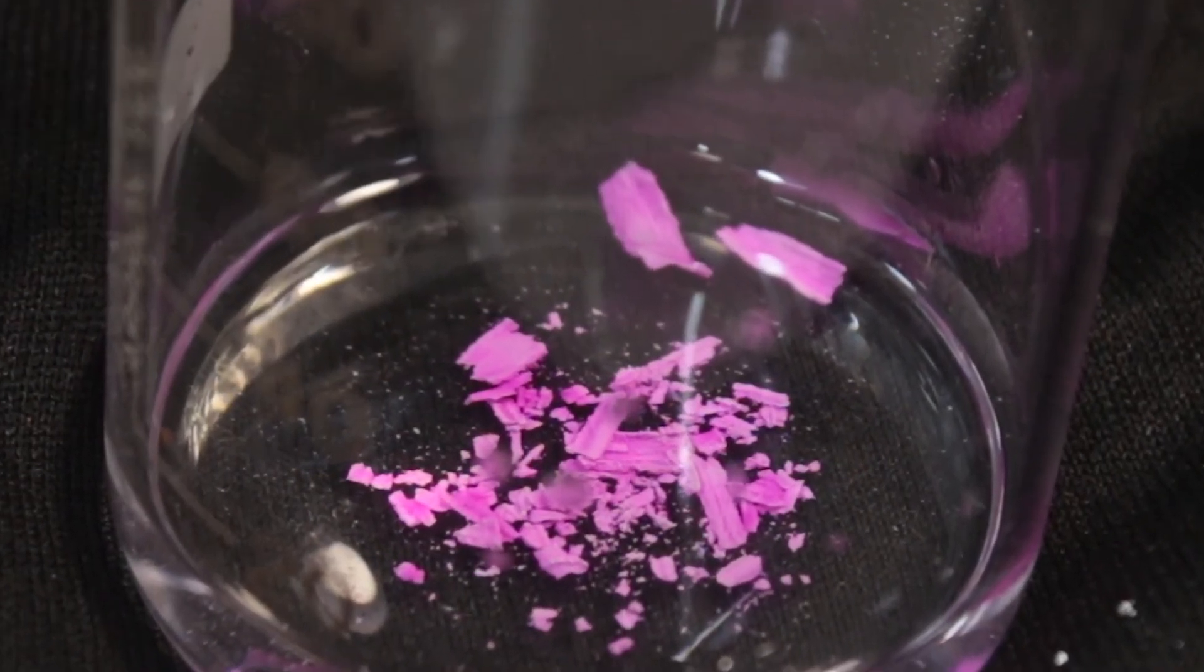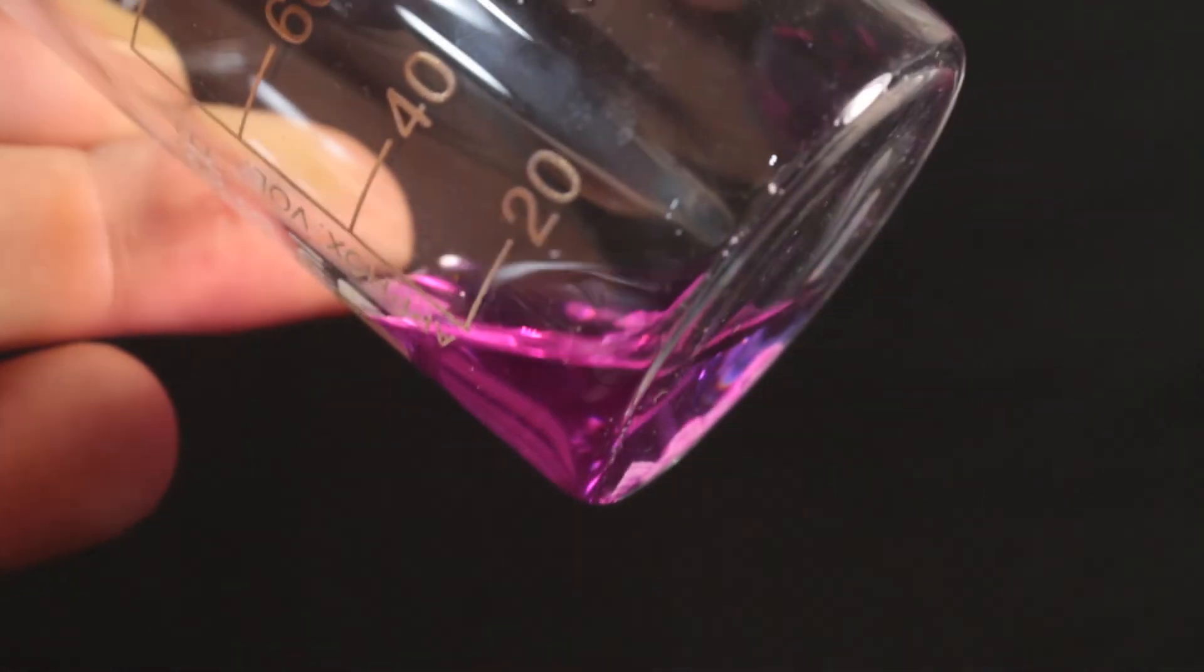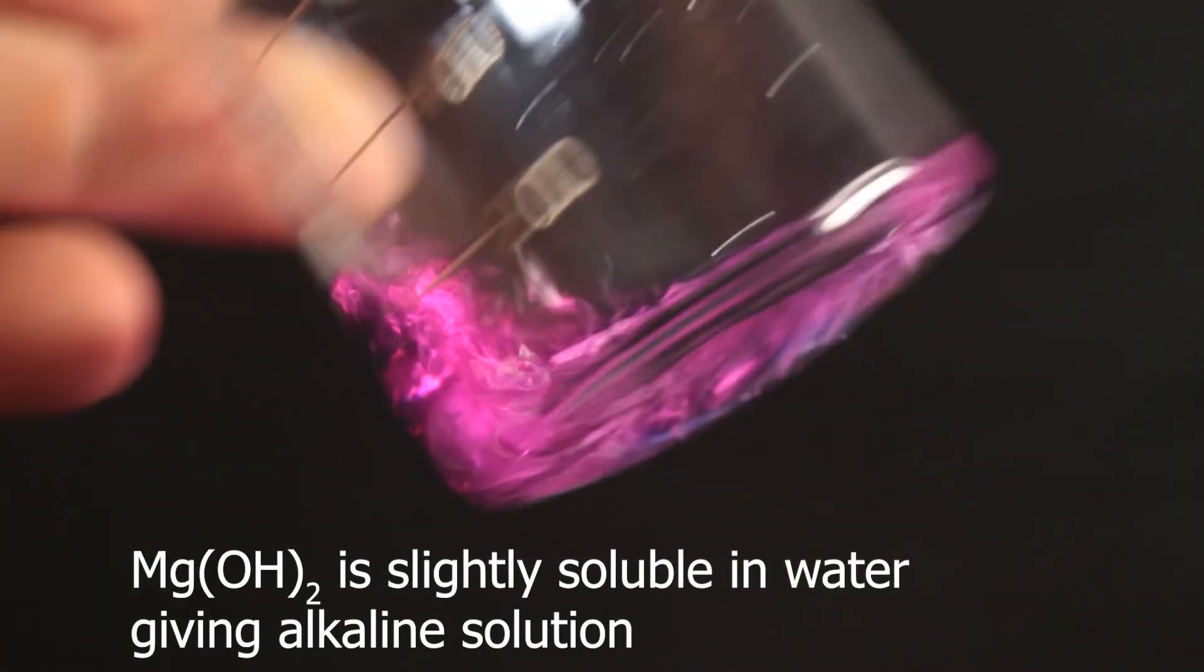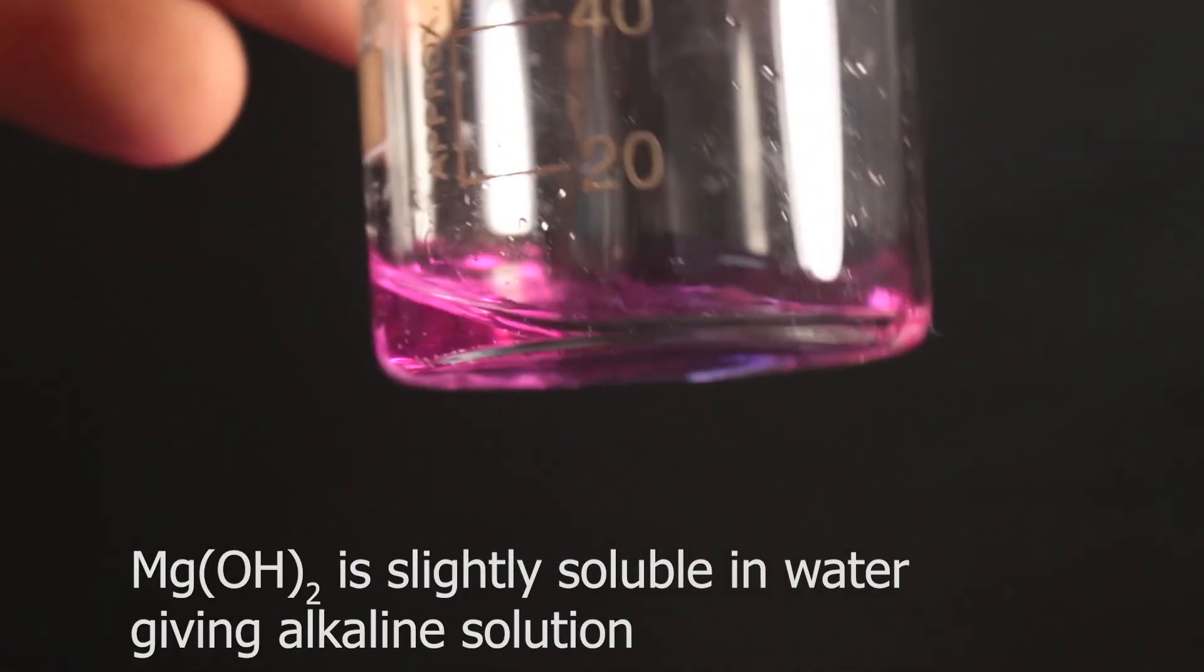Again, magnesium hydroxide is not very soluble in water, but if you wait long enough and shake it, we can see alkalinity spreading all over the solution.